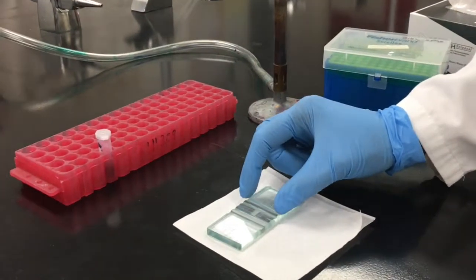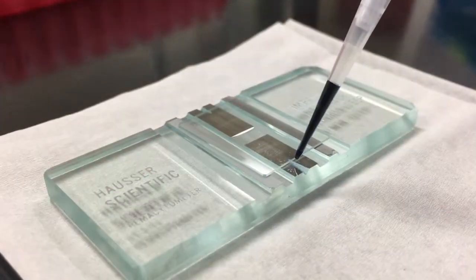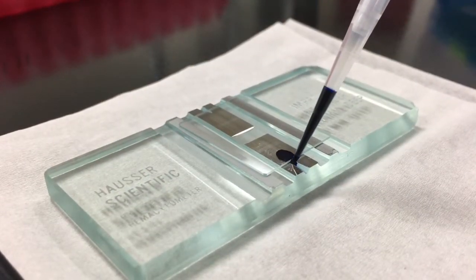Begin by placing the cover slip over the center of the counting chamber so it covers both sides. Take an aliquot of up to 20 microliters of the dyed suspension into your P20.